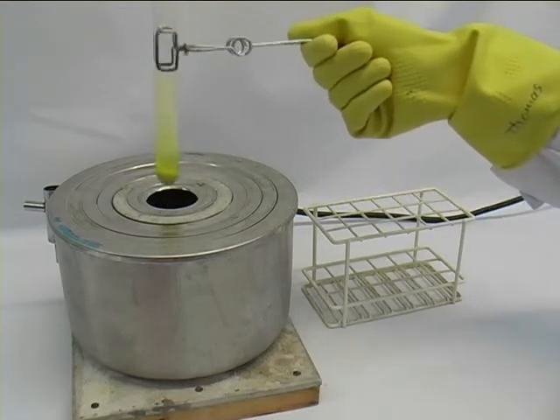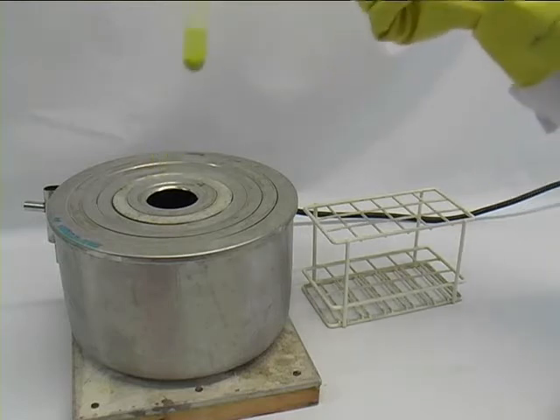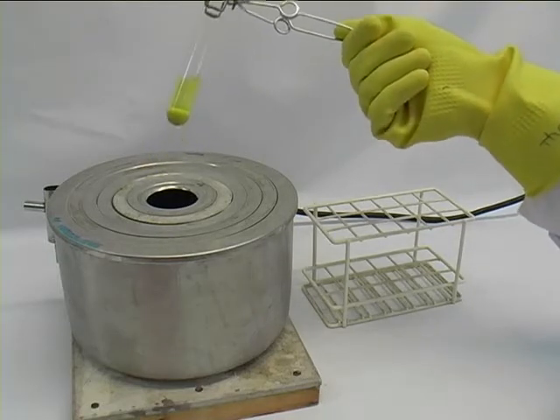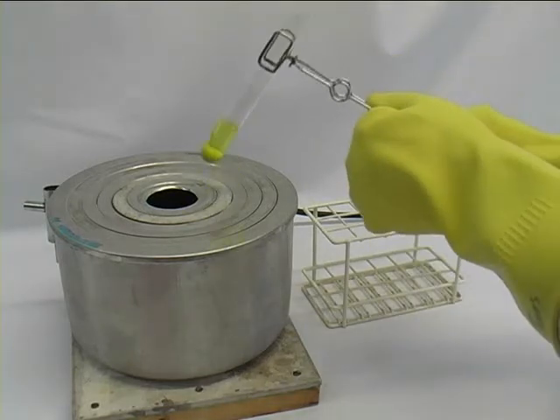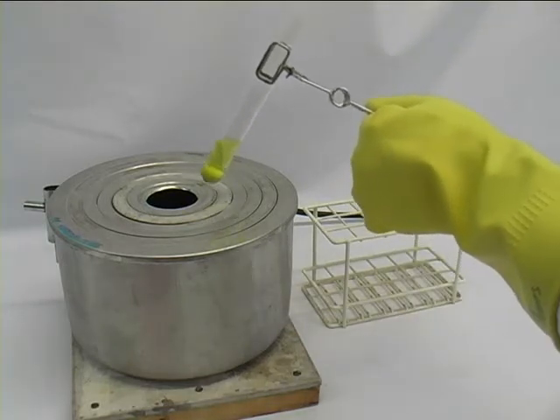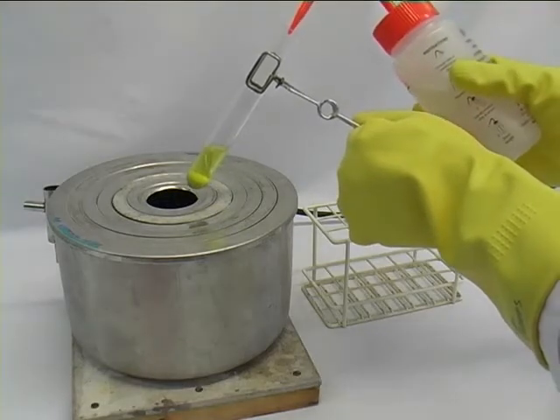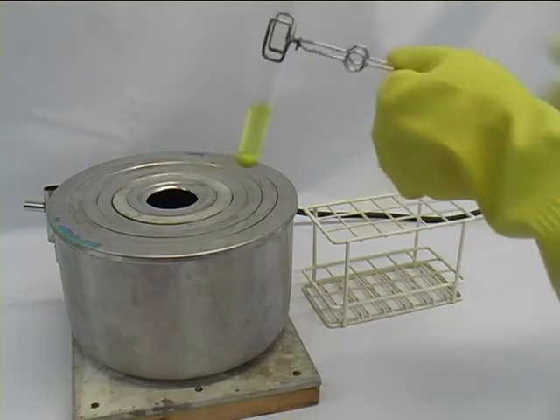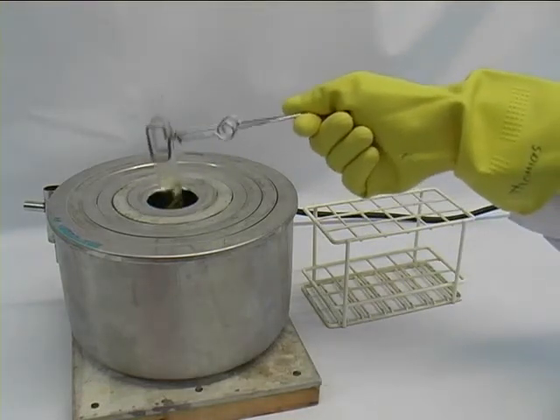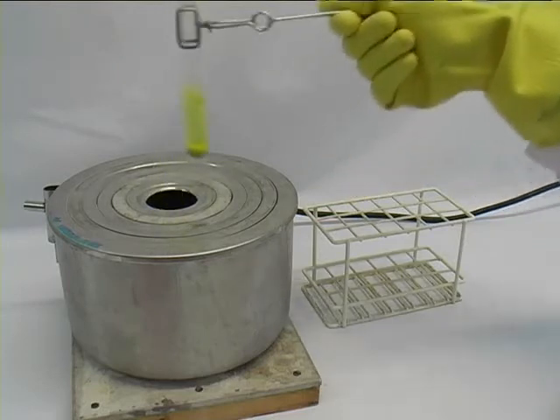In case not everything dissolves in the amount of solvent you have chosen at the boiling temperature, you might want to add a little bit more. Do that in small increments. Again, heat it up to the boiling point of your solvent and see if it dissolves everything.